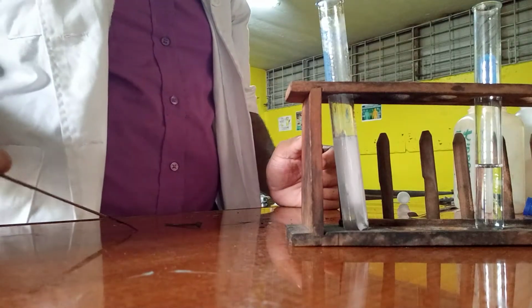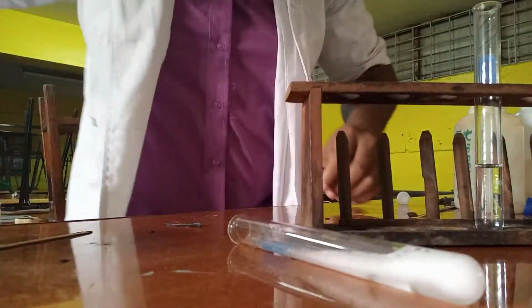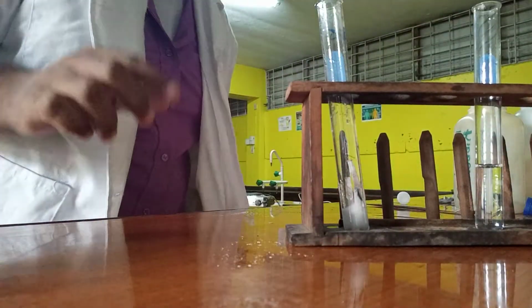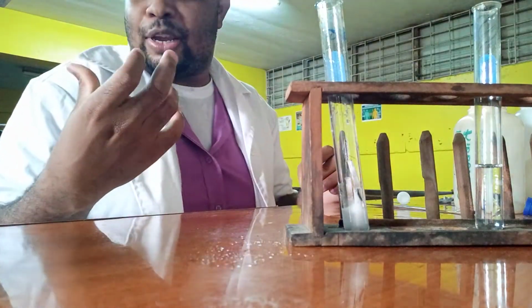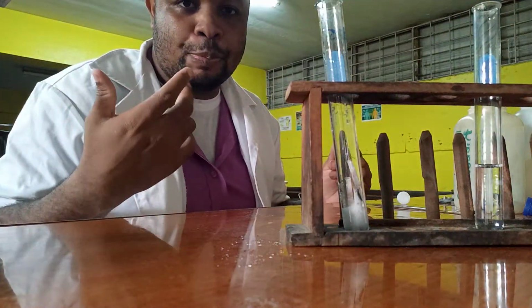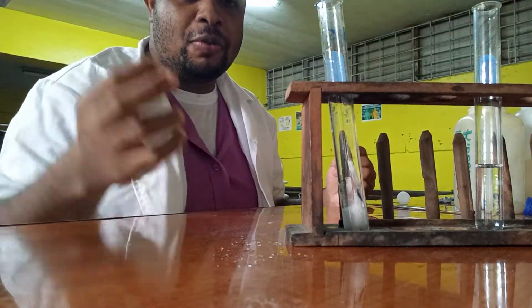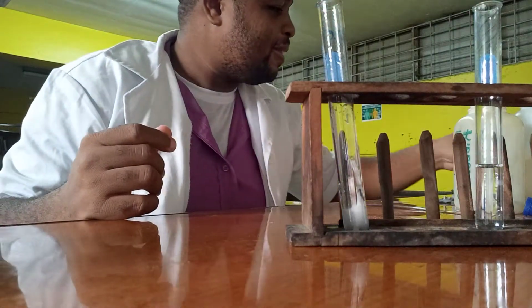So I hope you heard that pop sound. Continuing, the test tube is actually hot. That's my bad. When metals react with acid, the reaction is exothermic, so heat is produced. A lot of heat was just produced, so the test tube got hot. Well, too hot in this case.